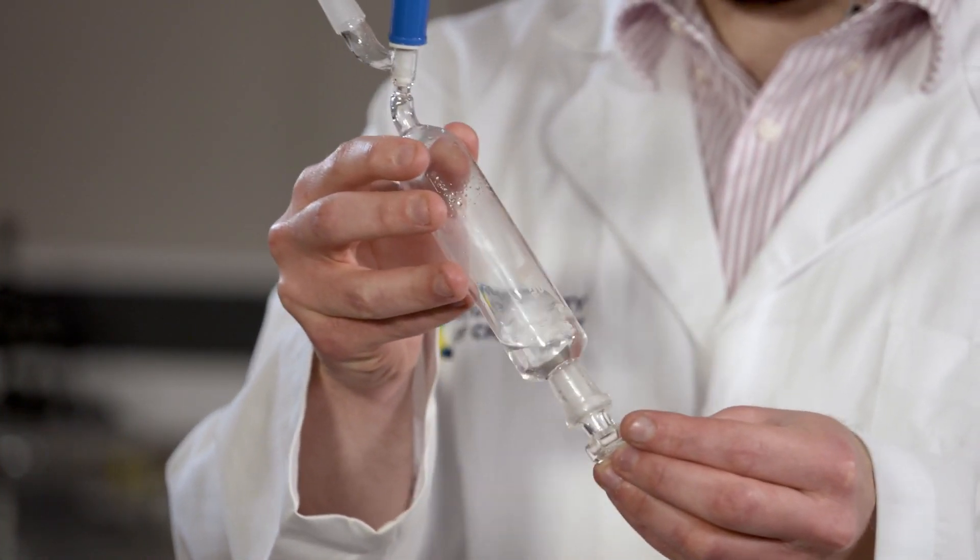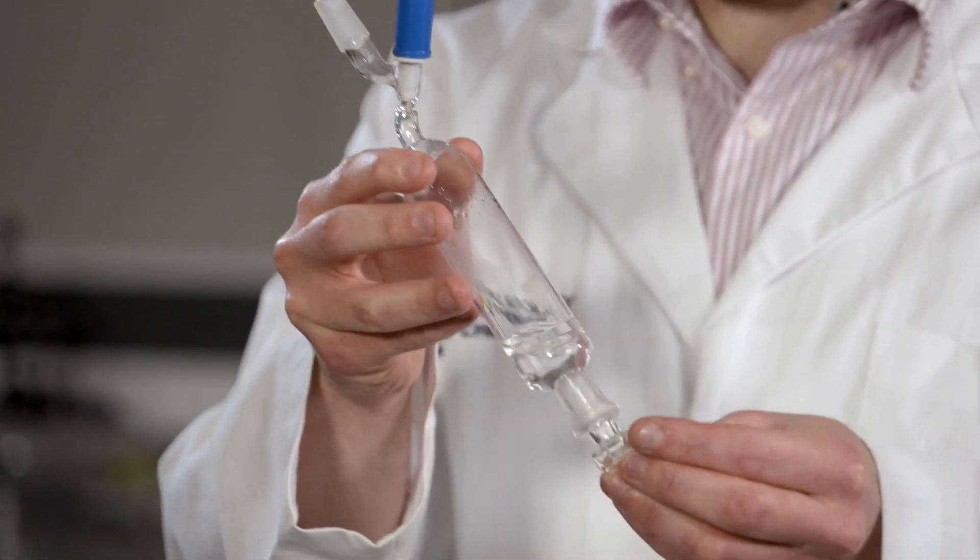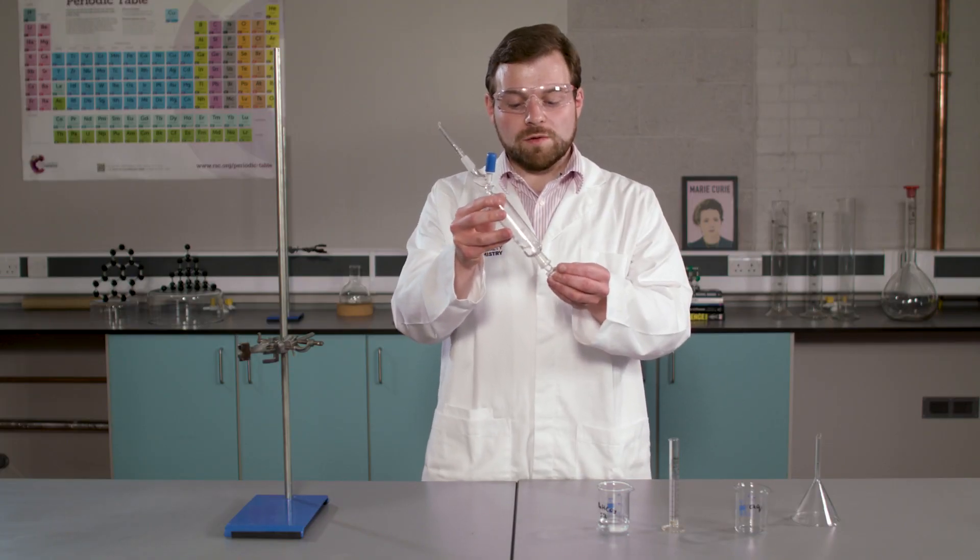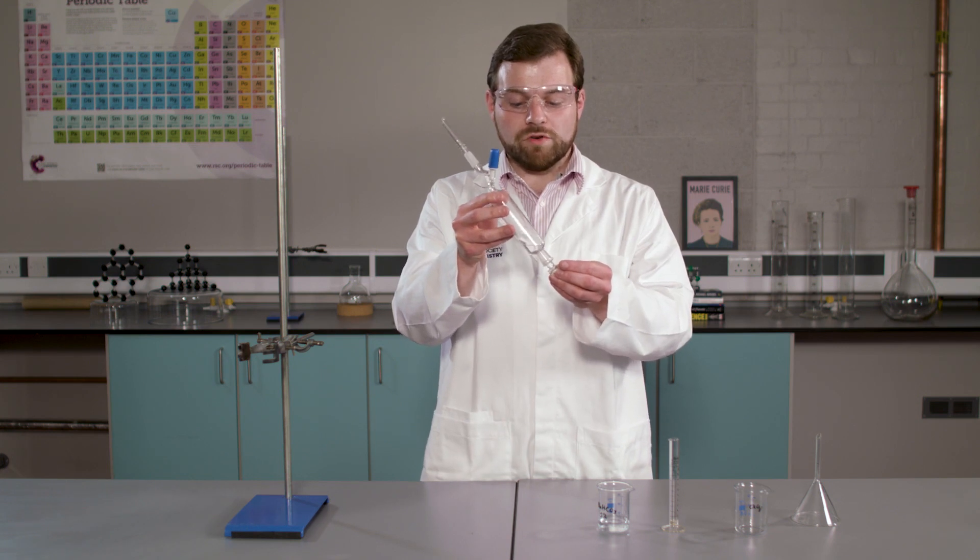Note, I'm swirling this and not shaking it, so to prevent pressure from building up. Sometimes you may see effervescence. This is carbon dioxide being given off from our neutralization reaction.